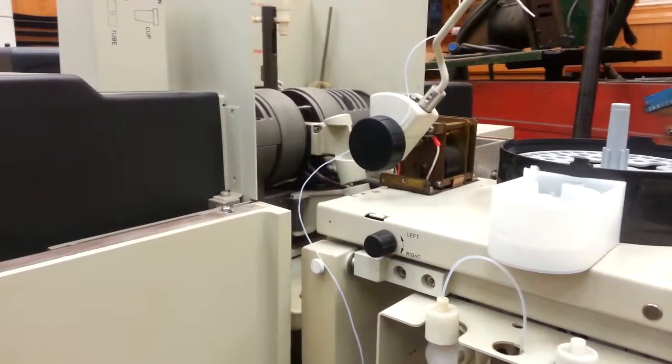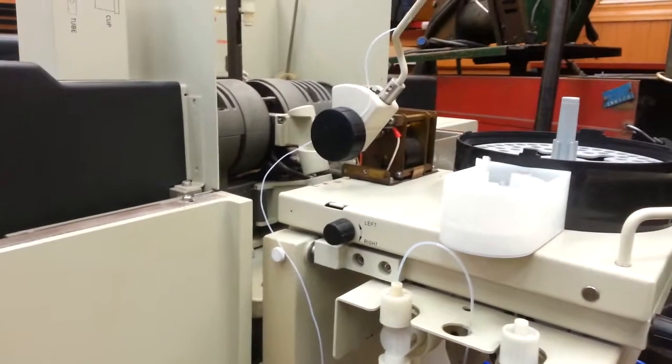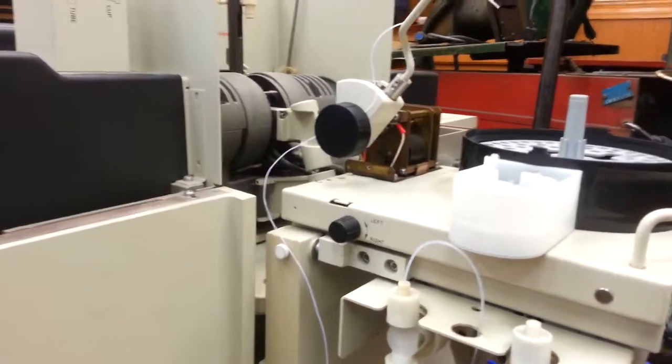It is Saturday, March 12th, and we're here again working on the auto sampler for the atomic absorption spectrophotometer.